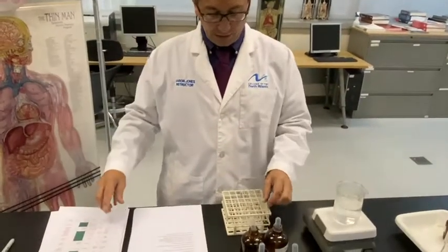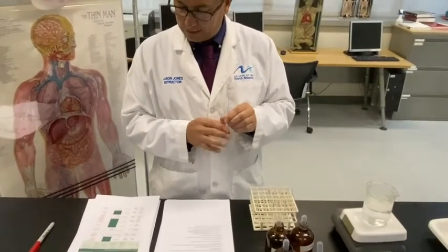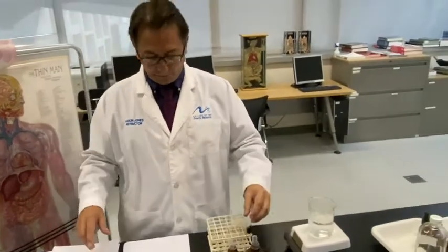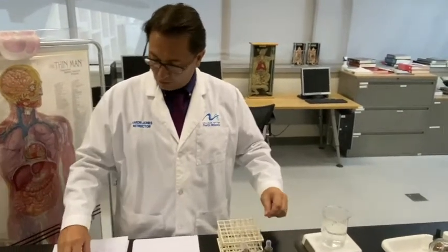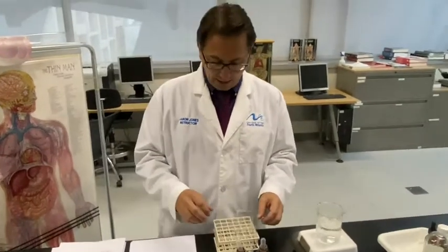You can fill out your table as you go. So we had our slightly cloudy starch solution, and that goes in column 3. Column 4, the color with the indicator added would be blue-black. Okay, we're not going to heat this test tube, and then we'll go through the results after we've done all the procedures.